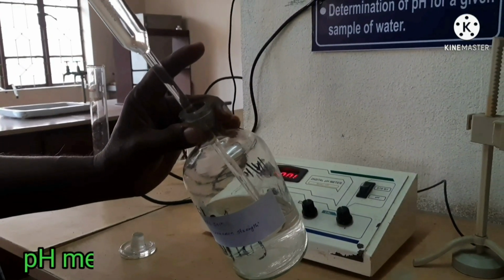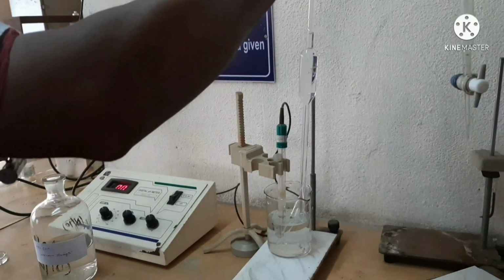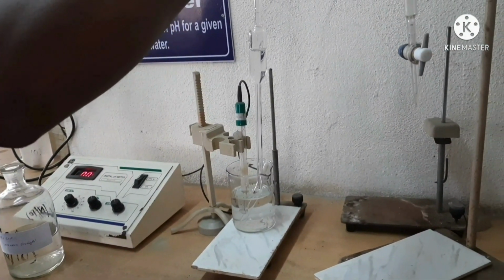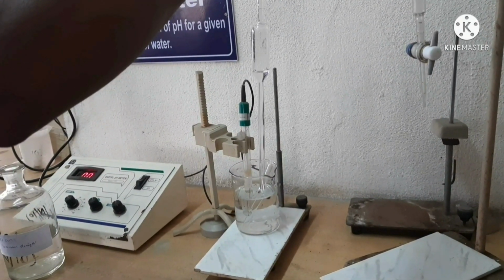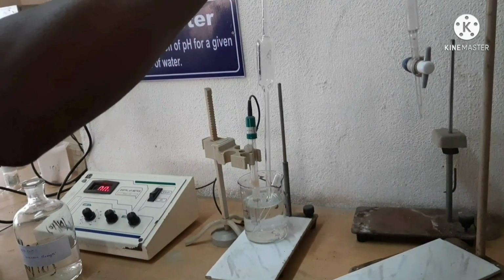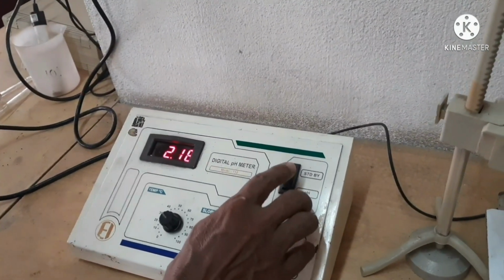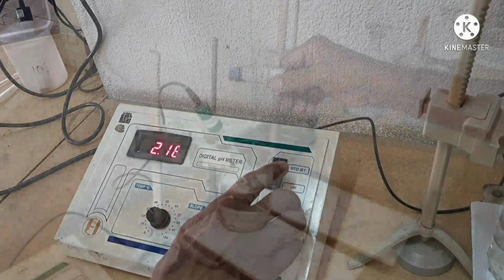From the supplied bottle of HCl, we are taking out 25 ml and it is then poured into a 500 ml beaker where the electrode of the pH meter has been immersed in distilled water. After stirring the solution, we will measure the pH value by the pH meter and the value shows 2.18.